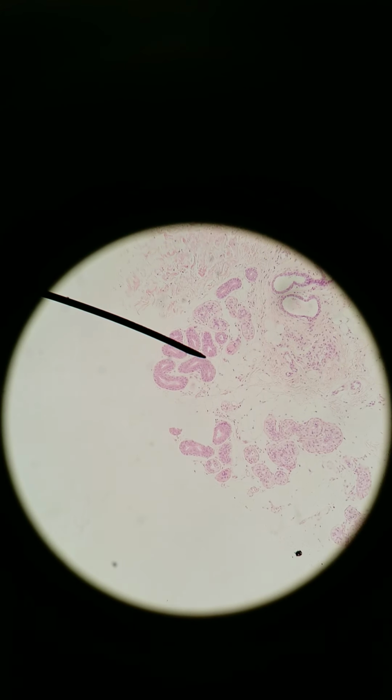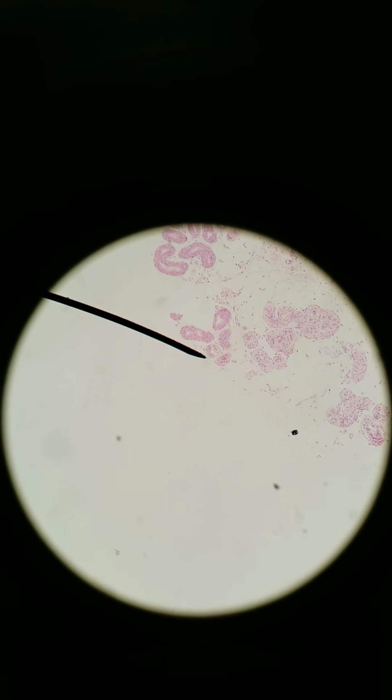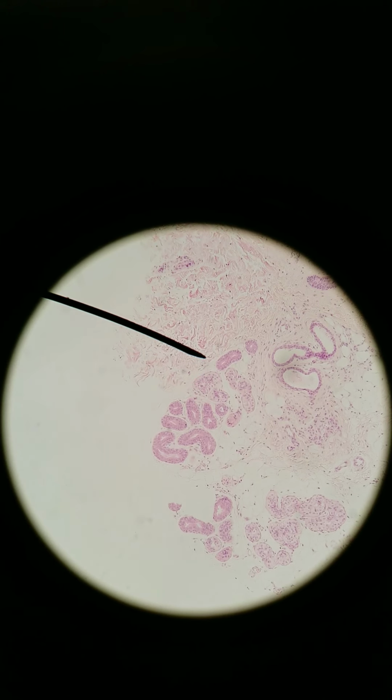These are the eccrine sudoriferous. When you look for eccrine sudoriferous glands, or really any gland, it's always going to be simple cuboidal or stratified cuboidal. And when it's stratified, that just means 2 layers, really, 2 or 3 layers. If it's more than that, then you're looking at a hair follicle. And I can show you another example of that in a second. So these are eccrine sudoriferous, a collection of eccrine sudoriferous glands, the watery sweat.